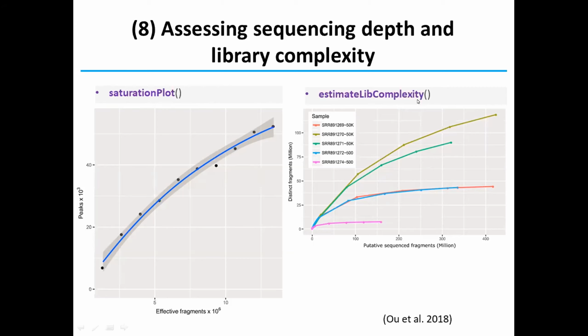So we can use the estimate library complexity function in the package to estimate the library quality, library complexity. Showing here on the right is the library complexity for different biological replicates. For this one, the purple line showing ATAC-seq assay with 500 cells, which has a pretty poor library complexity. After sequencing about 10 million reads, something like that, the library was saturated. But for some other library, like this green one, you can see the library is barely saturated, even after sequencing for 400 million.